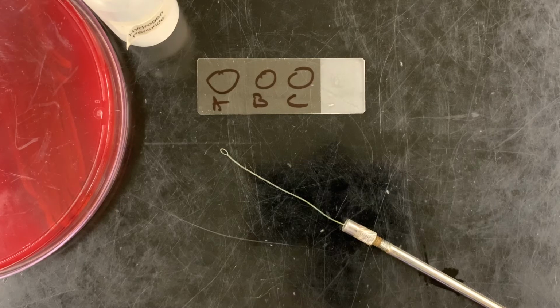So as the reaction proceeds, the production of oxygen will be visualized as bubbling within our mixture. Bubbling means that the bacterium contains catalase, so it's catalase positive. No bubbling, and it's got to be vigorous bubbling, means that the bacterium does not contain catalase and thus is catalase negative. Relatively straightforward, many ways to do it.